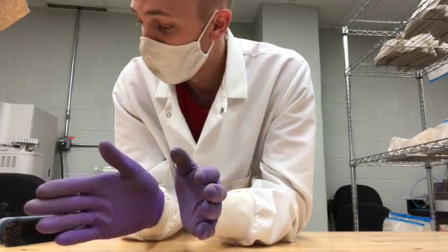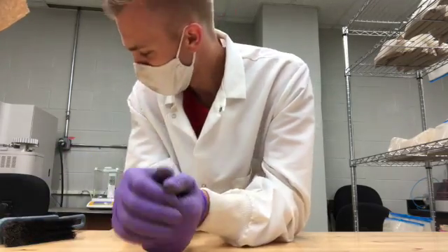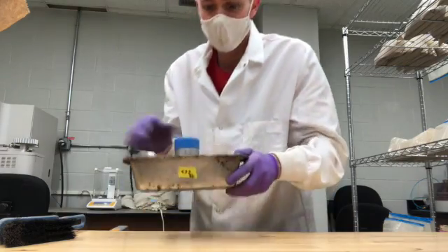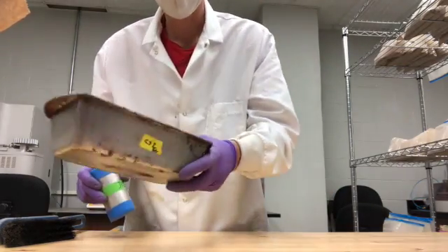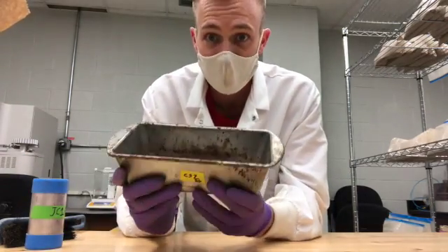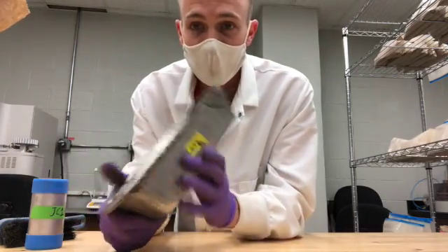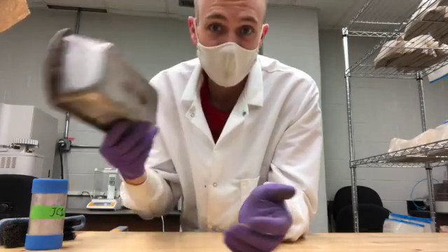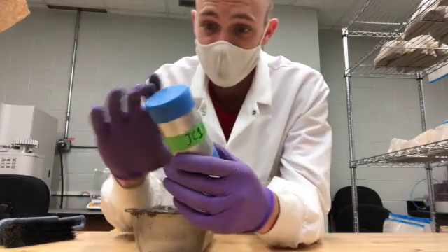This is the process of doing bulk density — the lab portion. The field portion I already did. In the lab, we get our pan — this is a bread pan, it's pretty rusted out. We get the tare weight, or the weight with nothing in it. I know this pan weighs about 153 grams, so we take this empty pan and I know the mass of it already.